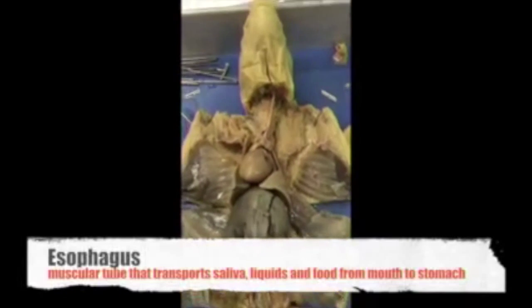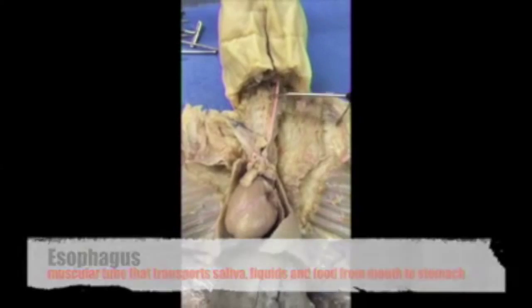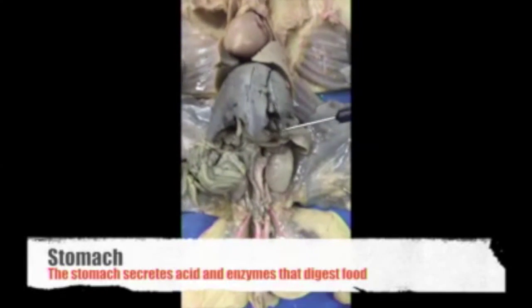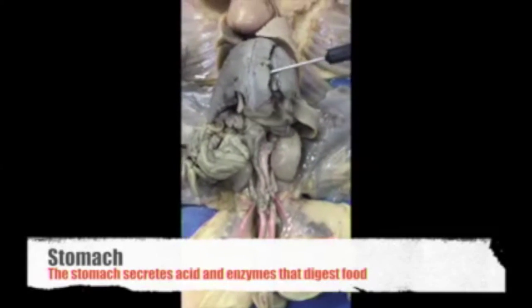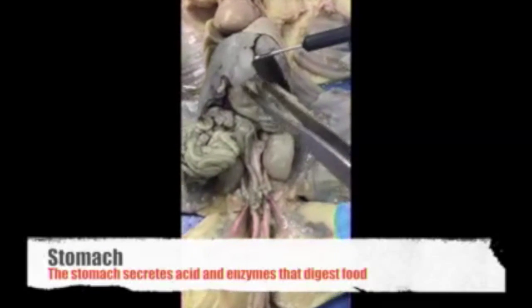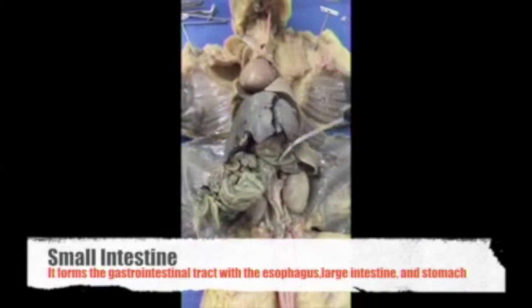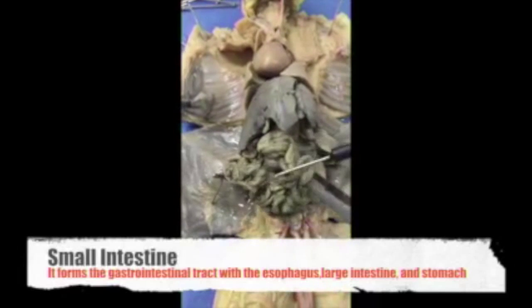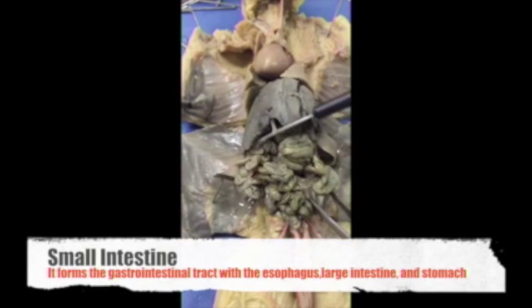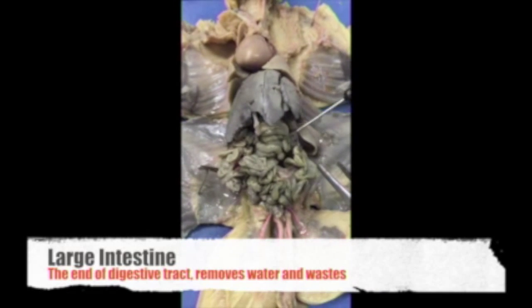This is the digestive system. We're going to start with the esophagus. Then we're going to move on to the stomach that is down here. I'm going to use these. Oh, here's the stomach. Next is the small intestine, which is this all right here. Then we have the large intestine, which is all jumbled up right here.